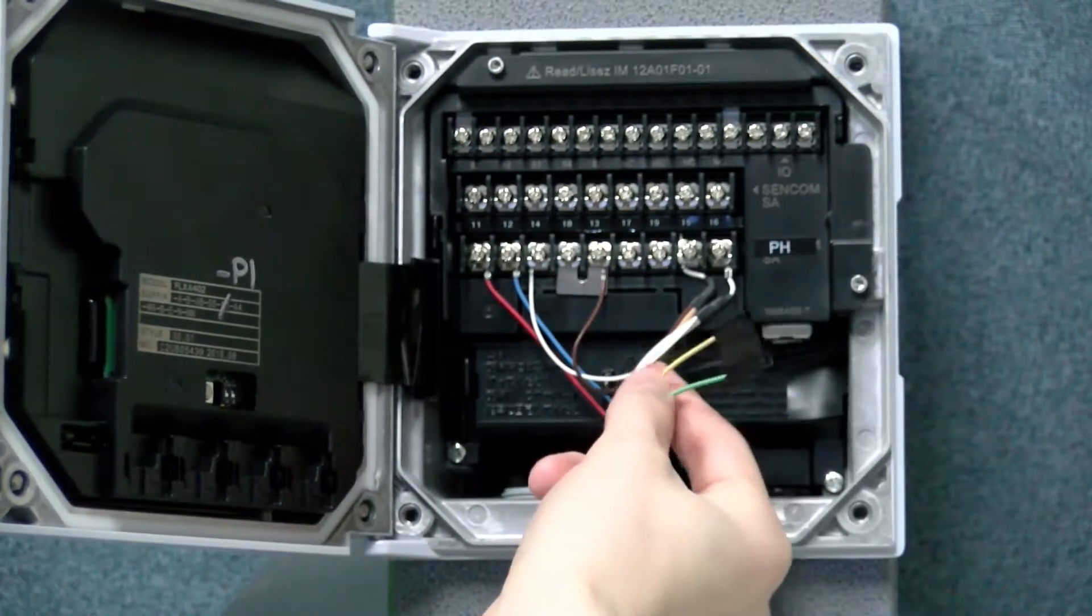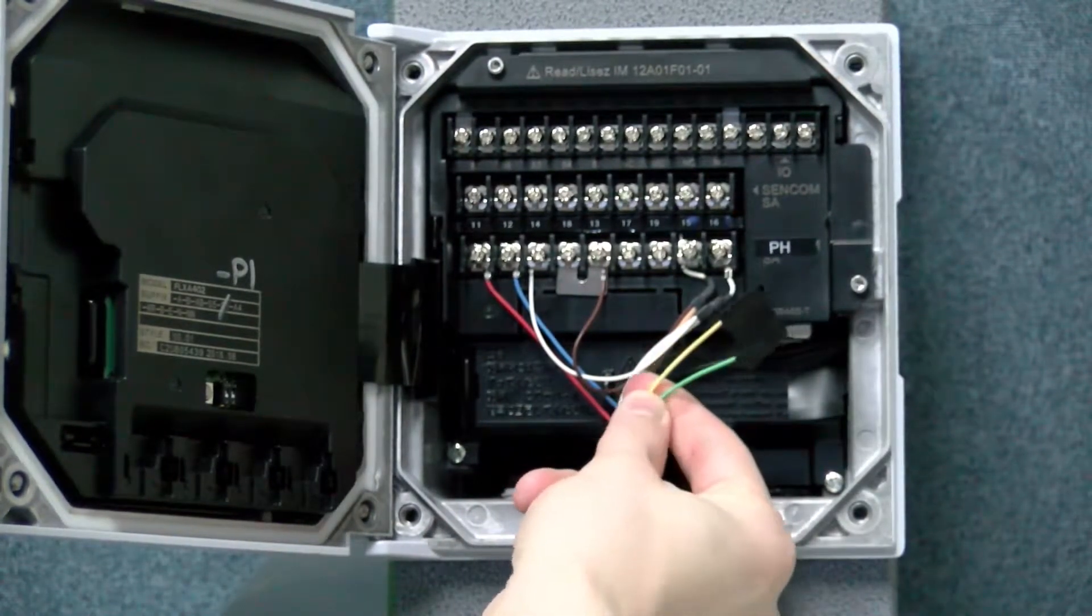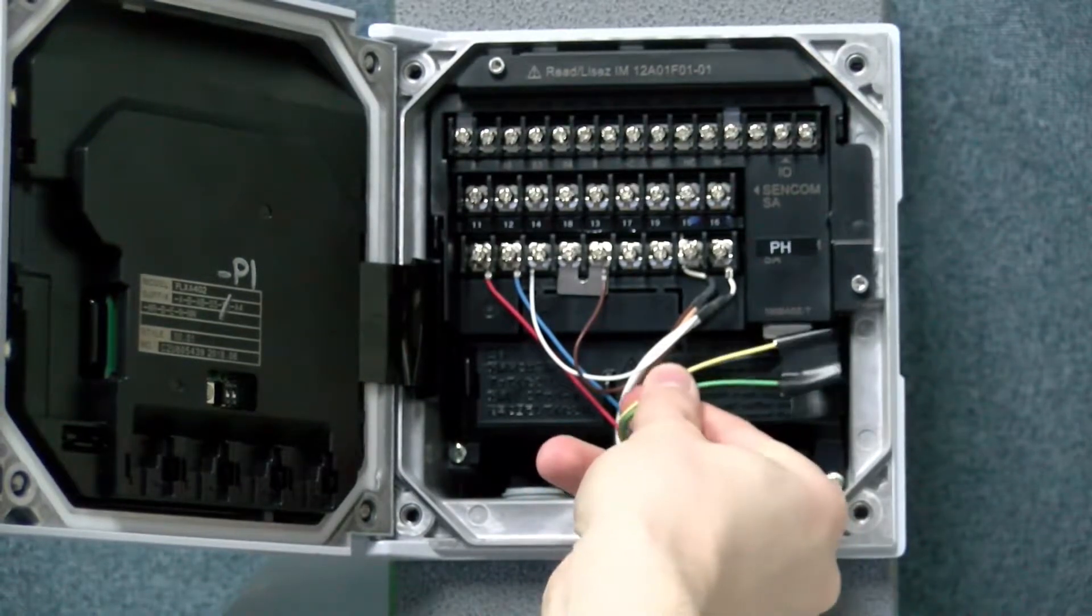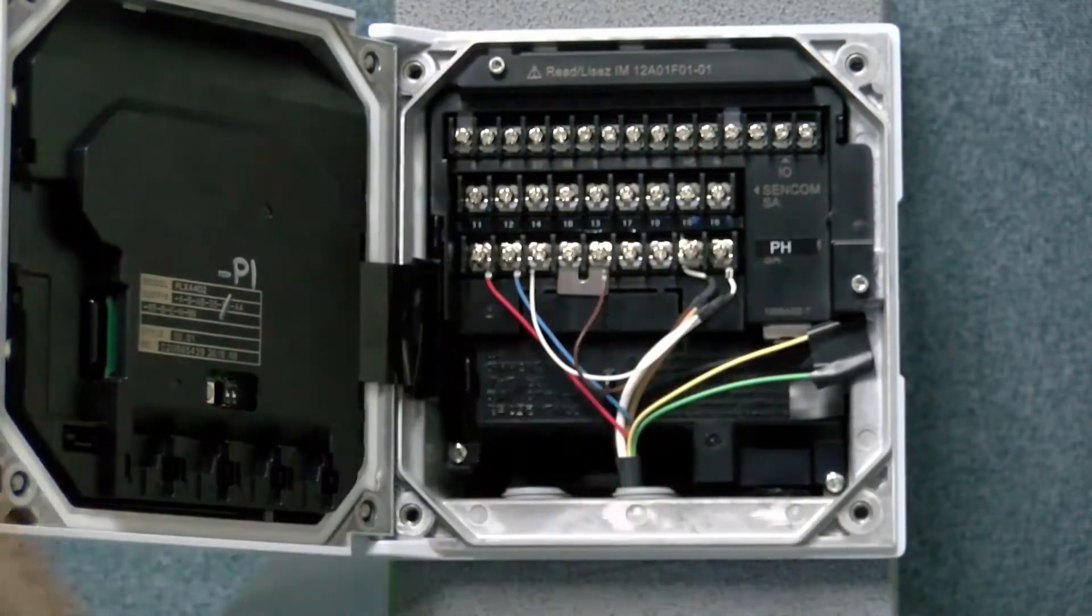In addition, we like to tie off the yellow and green wires, as they are not going to be needed in this application. And then now I'm going to power it up and show you that it works.